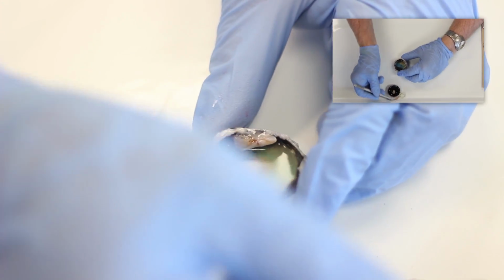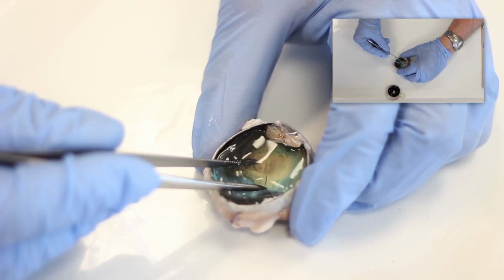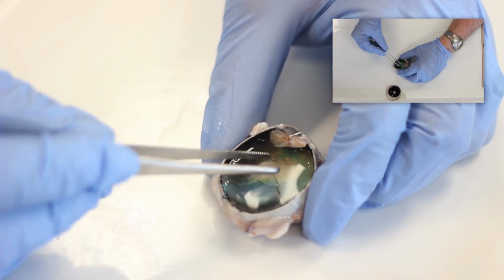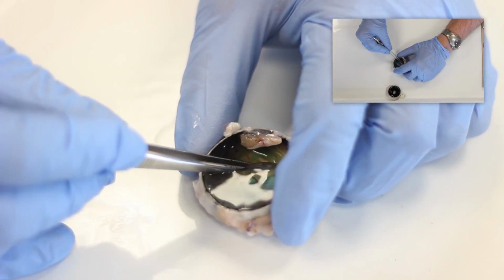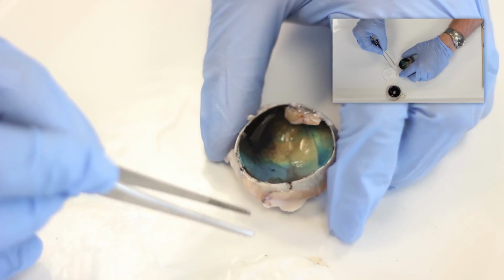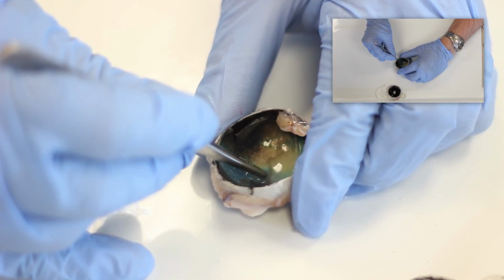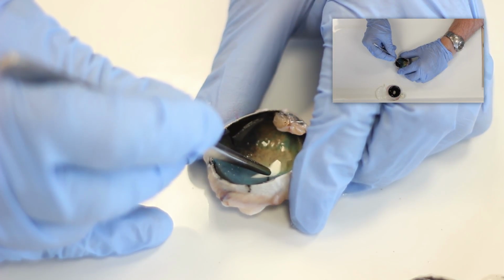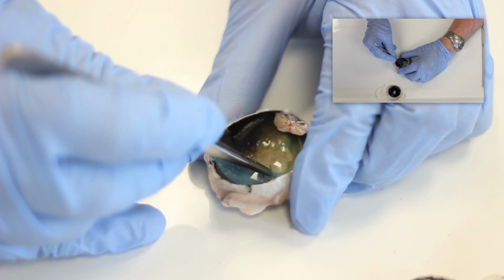Now turn your attention to the posterior aspect of the interior of the eyeball, and you will notice that there is a gelatinous fluid in the posterior aspect of the eye, the vitreous humor. You can remove the vitreous humor with the forceps, and that will reveal the interior of the eye. You're able to see at the very back of the eye the retina with the blood vessels coming out of the middle of the optic nerve head where the axons of retinal ganglion cells enter.